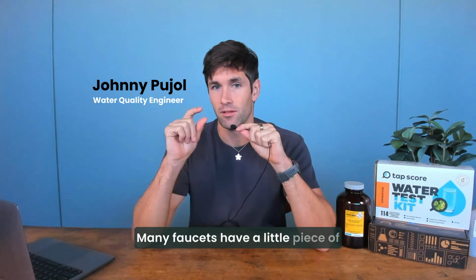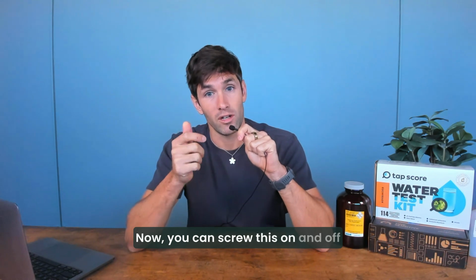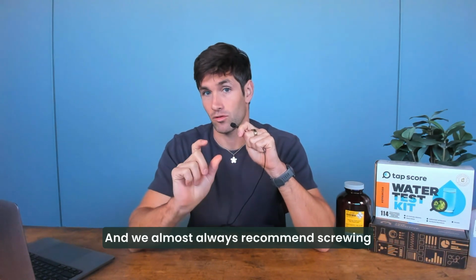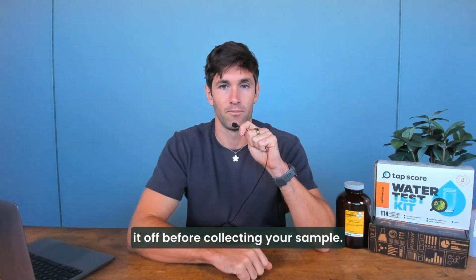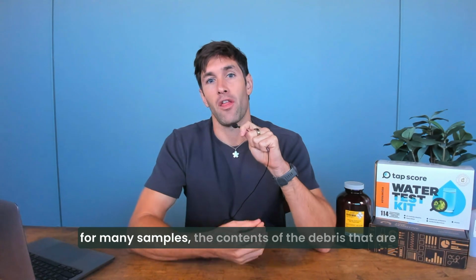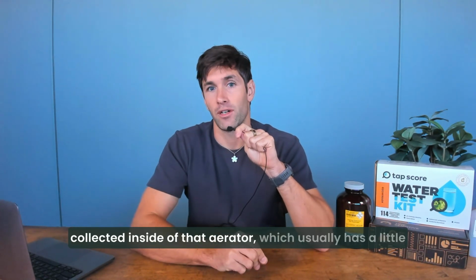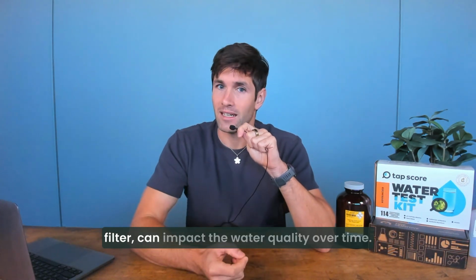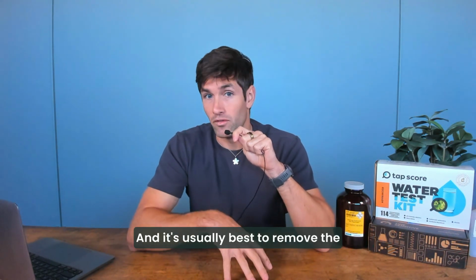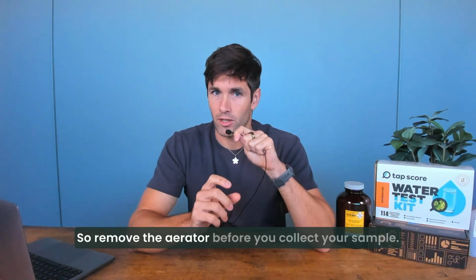Many faucets have a little piece of metal at the tip called an aerator. Now, you can screw this on and off most of the time if it's there, and we almost always recommend screwing it off before collecting your sample. The reason is a little bit nuanced and complicated, but for many samples, the contents of the debris that are collected inside of that aerator, which usually has a little filter, can impact the water quality over time, and it's usually best to remove the impact of that aerator from your sample. So remove the aerator before you collect your sample.